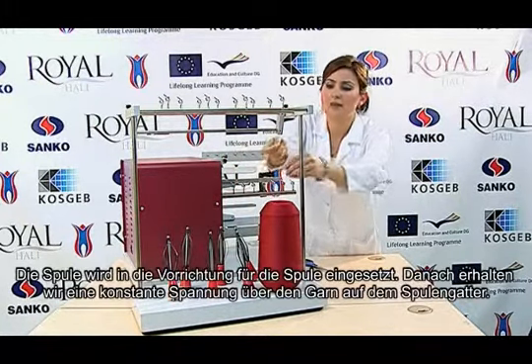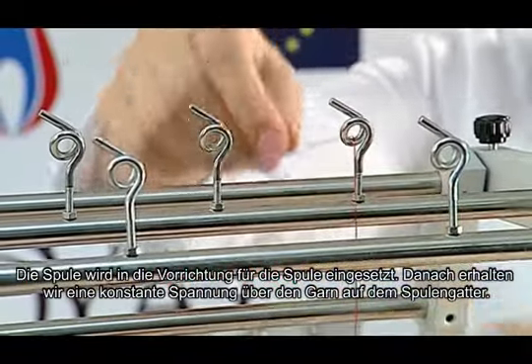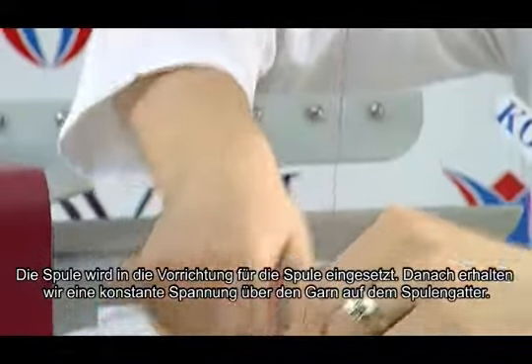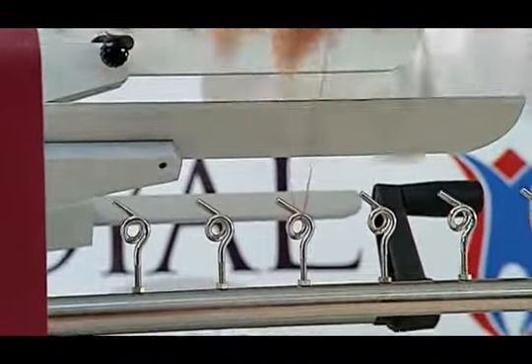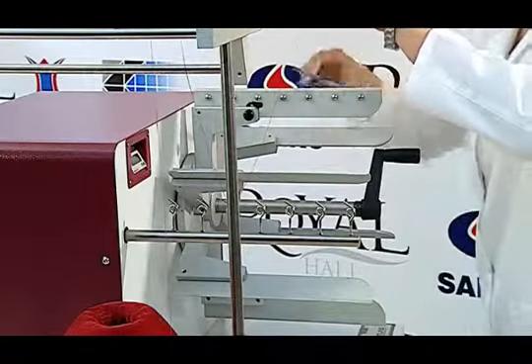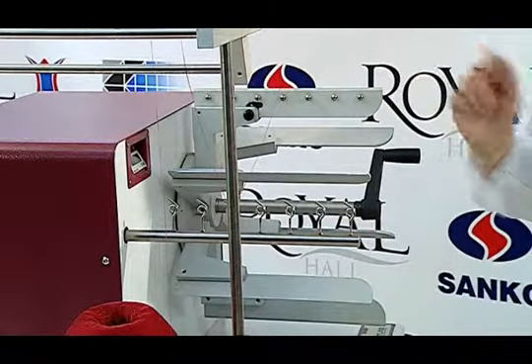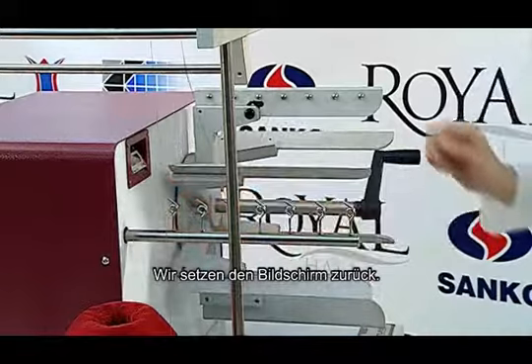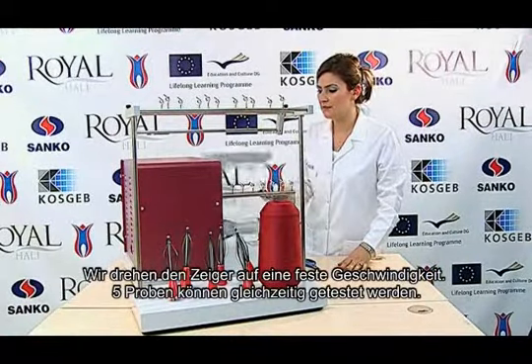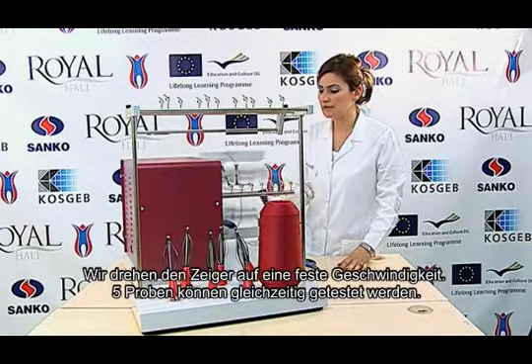The bobbin is installed into the bobbin placement apparatus. Then we get a constant tension over the yarn on the creel. A cycle of the reel is 1 meter long. We reset our screen. We turn the handle at a fixed speed. 5 samples can be tested simultaneously.